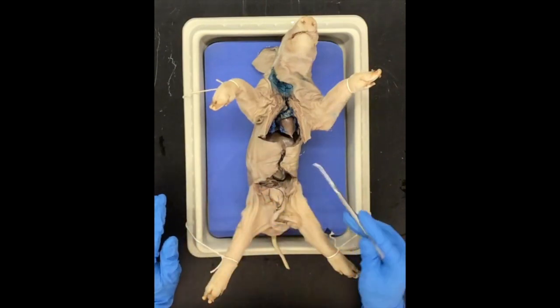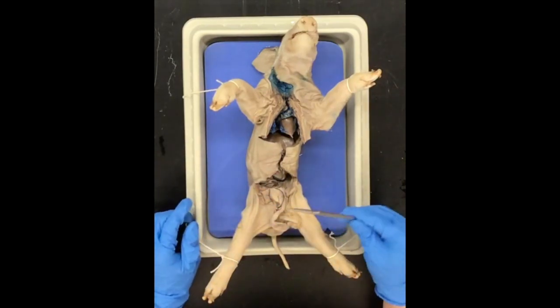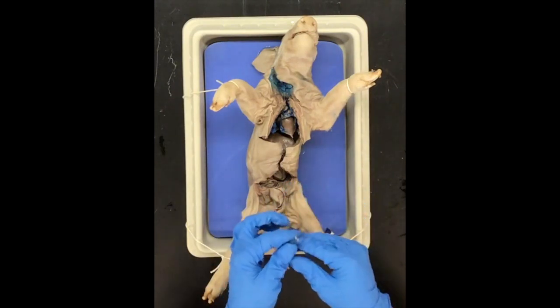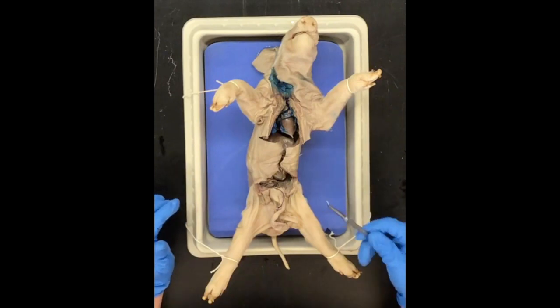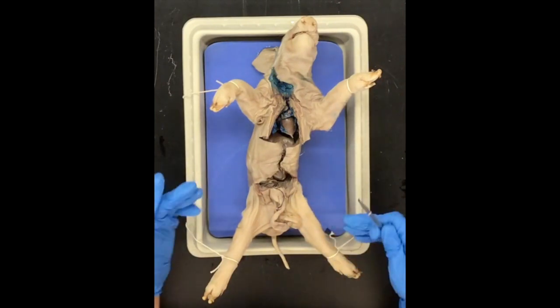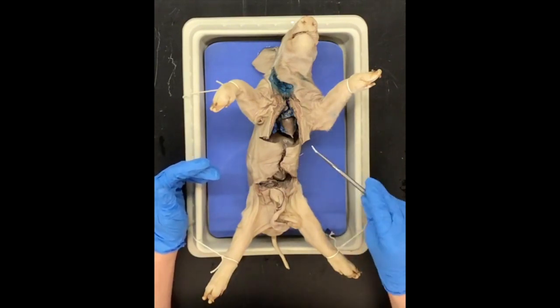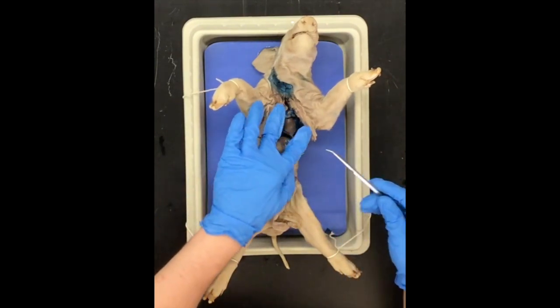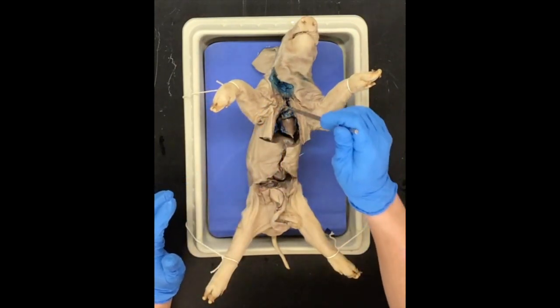This tool right here is called a probe — this is the first time we're going to use it. The probe has a blunt end to it, which is nice because it allows us to kind of explore or break some soft connective tissue and separate out organs without actually puncturing them. So we're going to use this just to help separate a little bit of connective tissue up in the chest cavity.